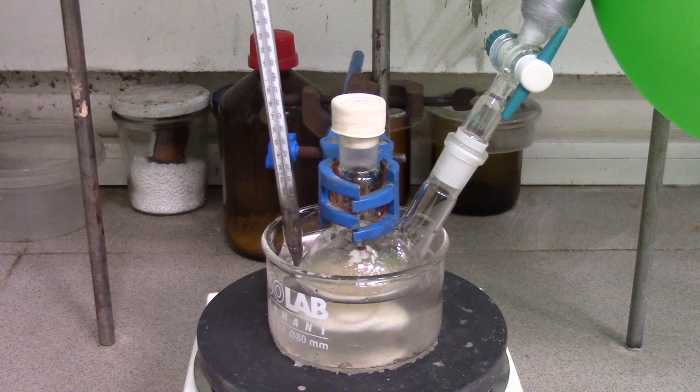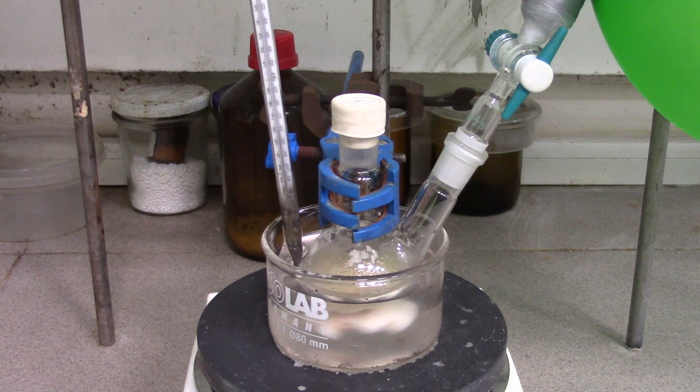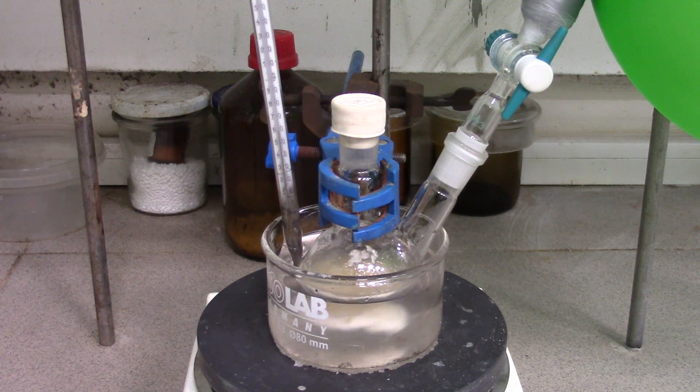Oh yeah, the reaction time should be between 4 or 6 hours, depending on your scale. Not as long, but pretty boring. Let's go see a small timelapse of the reaction.